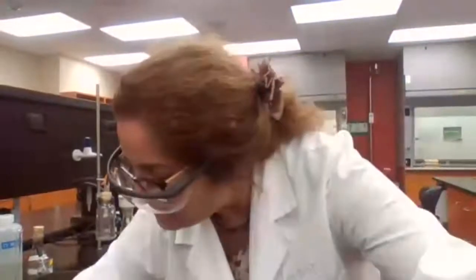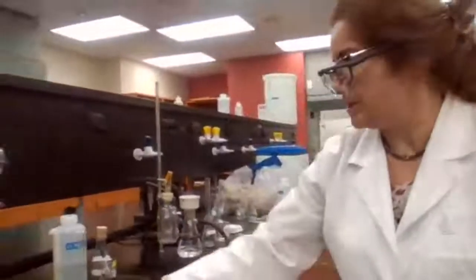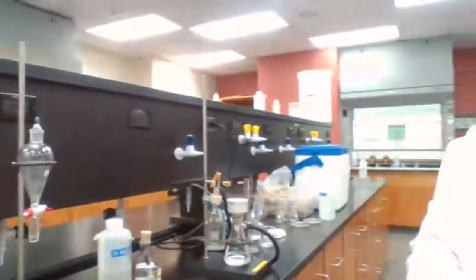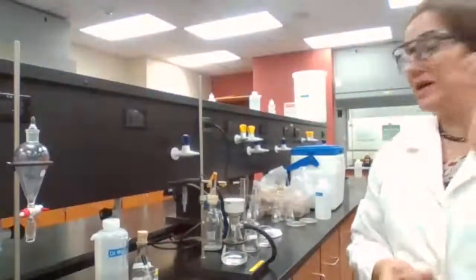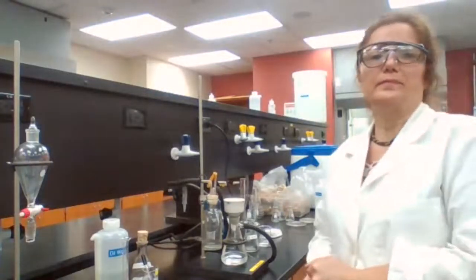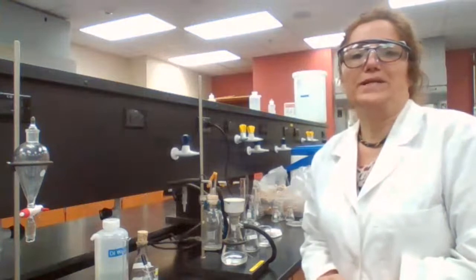Okay. With the spatula, I'm bringing the... Do you have any questions while we are waiting? Any questions for me?